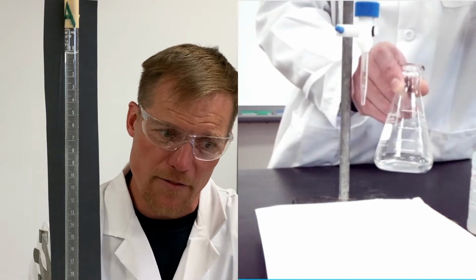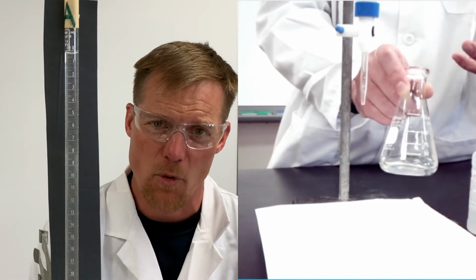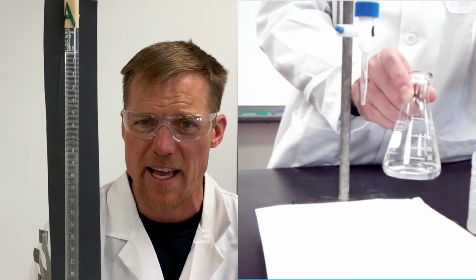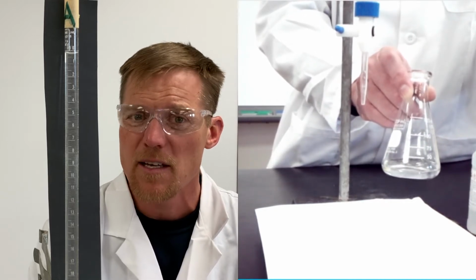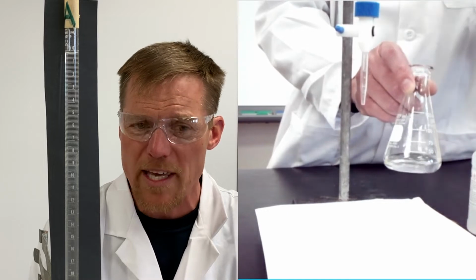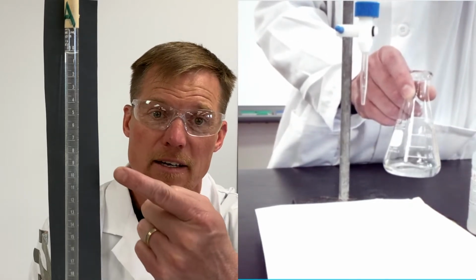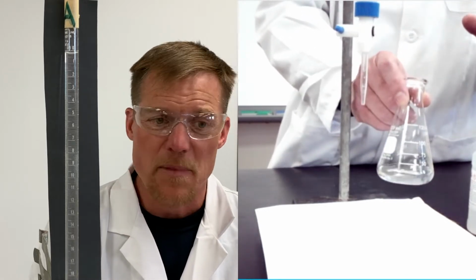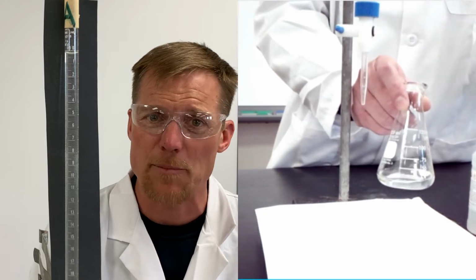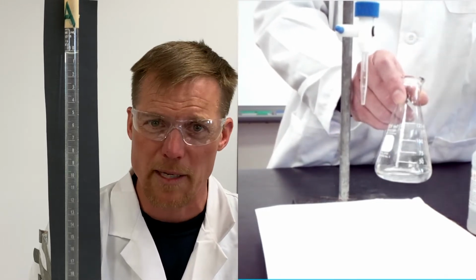As we add milliliters of acid and base to this water, it's gonna spread the color out more so that we can see it. Now, a couple of kids had asked me one time, hey, Mr. Schultz, won't that dilute the acid and the base? Yeah, it will, but we care more about diluting the acid and the base in our burette here than we do in here. You see, it's kind of like this. If I have 5 kids and I want to keep track of them, right? It doesn't matter if they're in a small pool or a big pool.